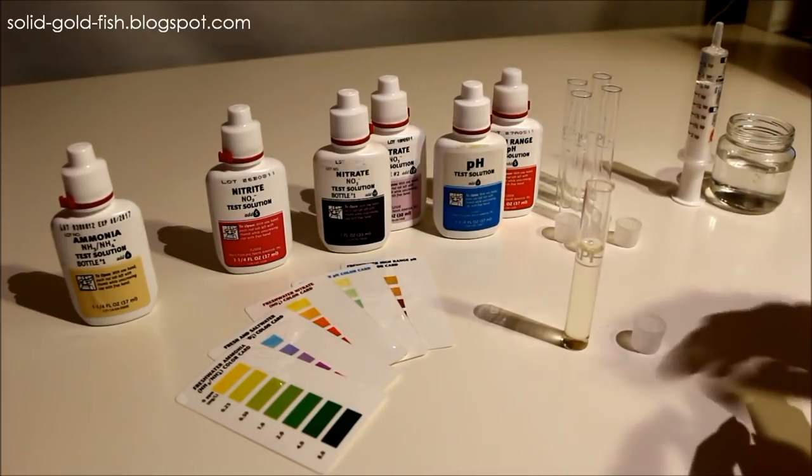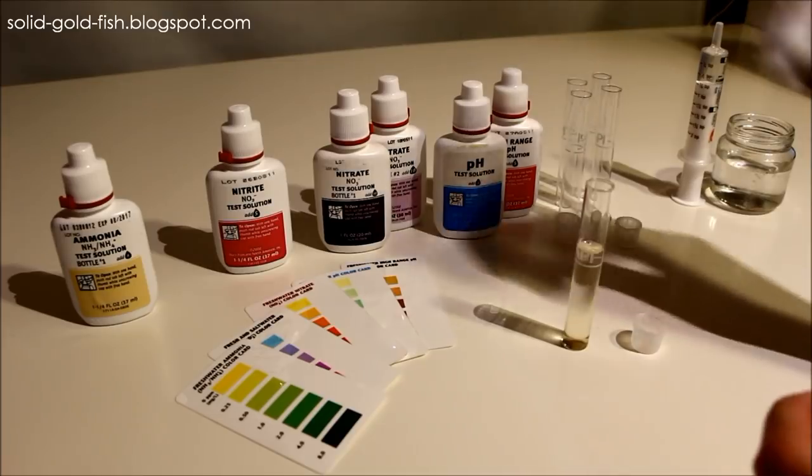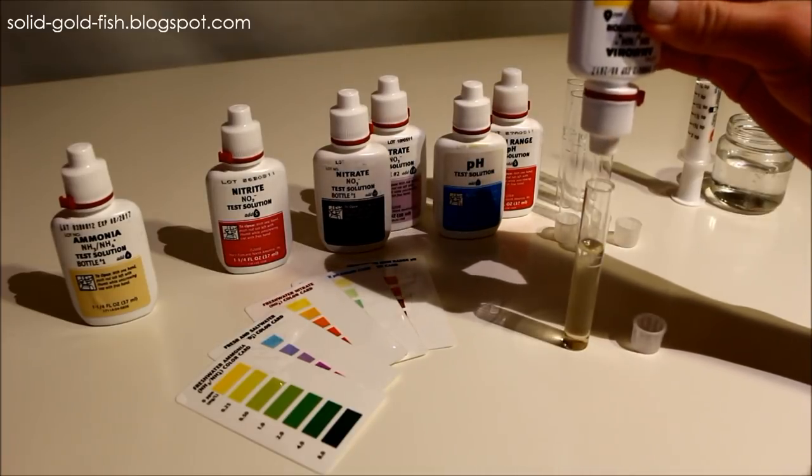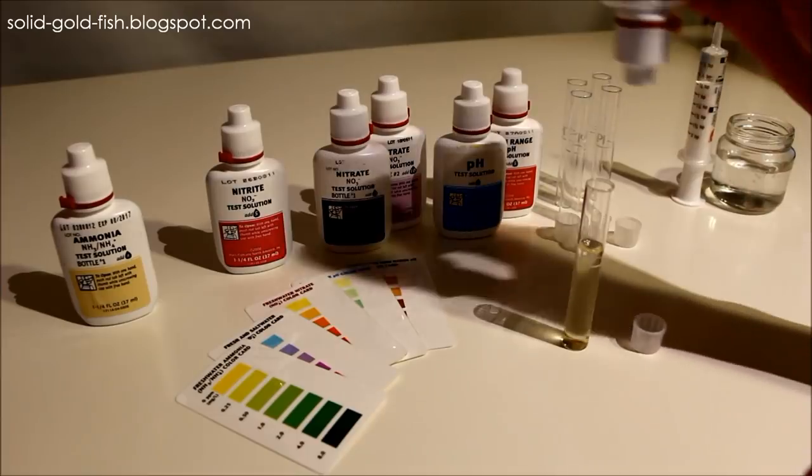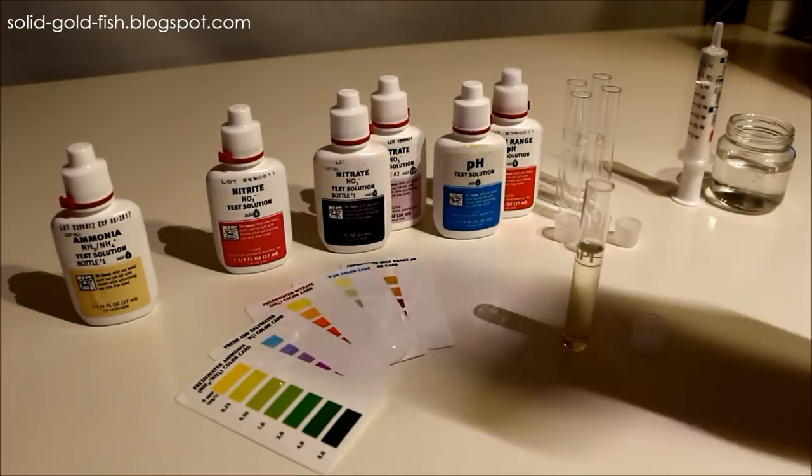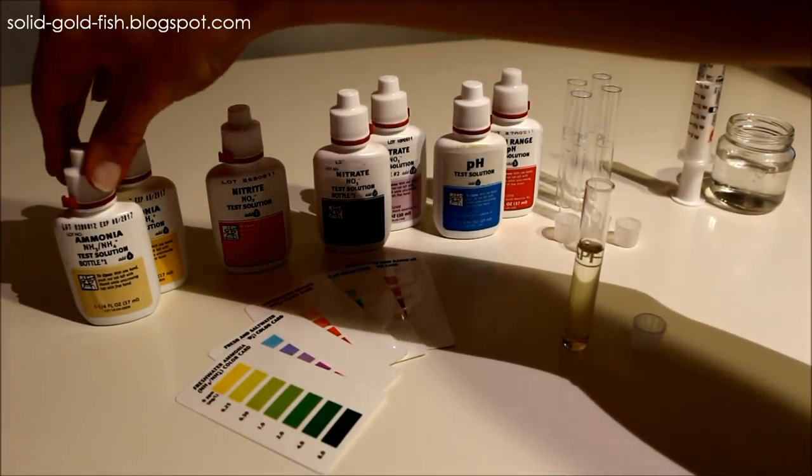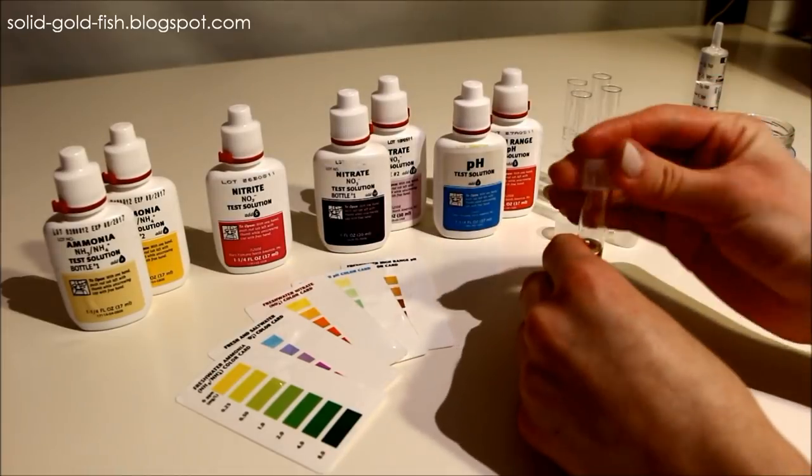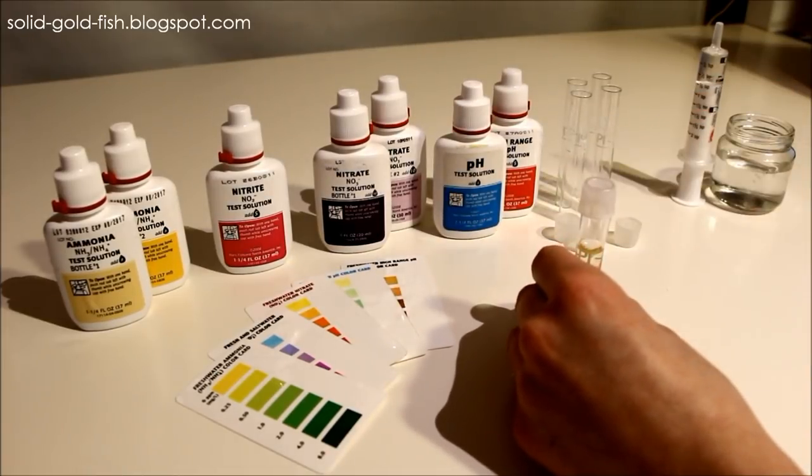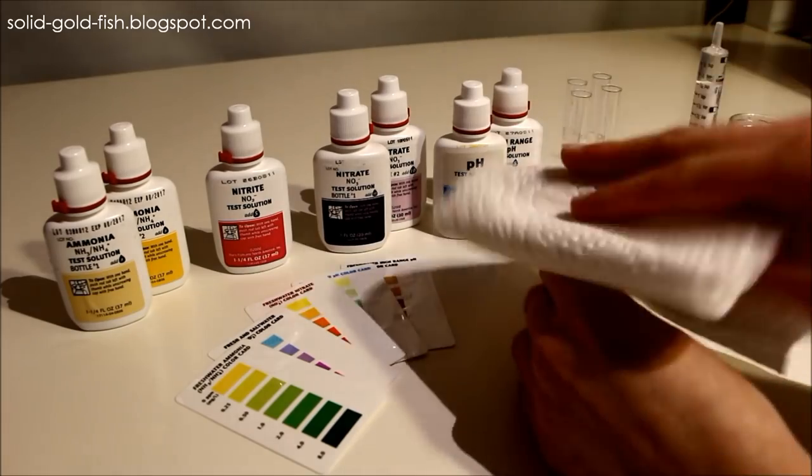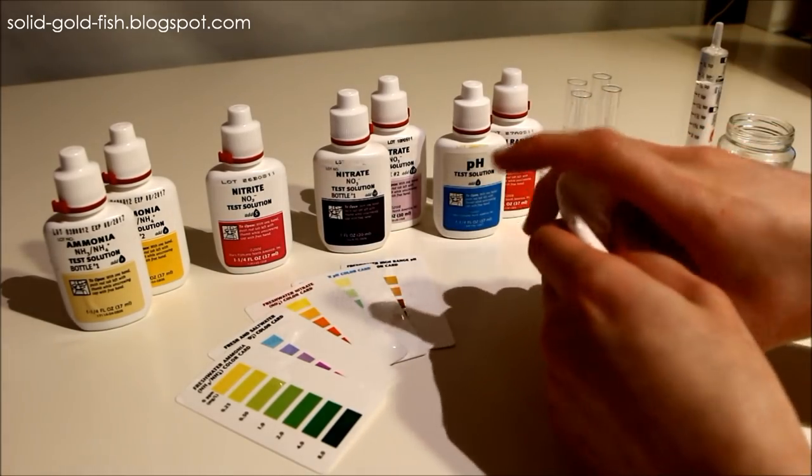It's really important when you're adding the drops that you hold every bottle straight up and down like this rather than tilting it. That makes sure that each drop is the same size. Then you cap it and I usually take a paper towel and put it over the cap because sometimes when you're shaking it they leak.